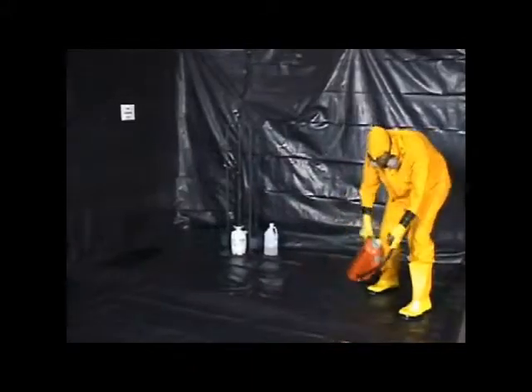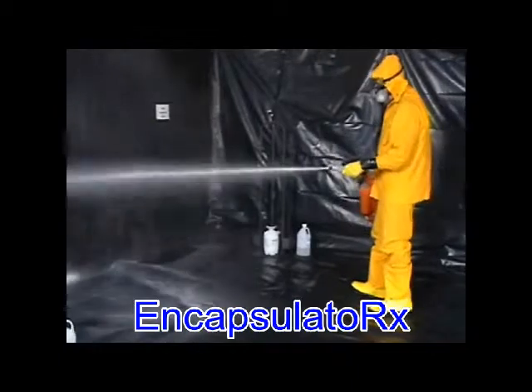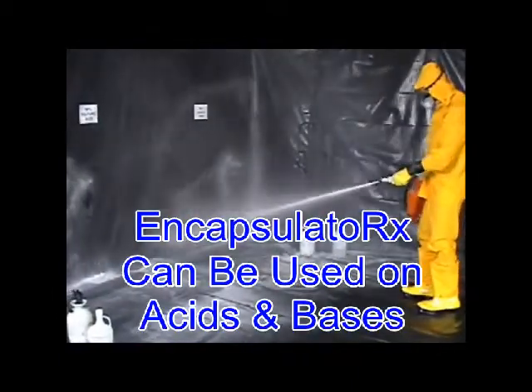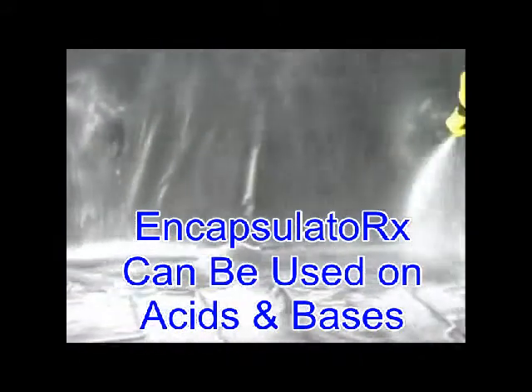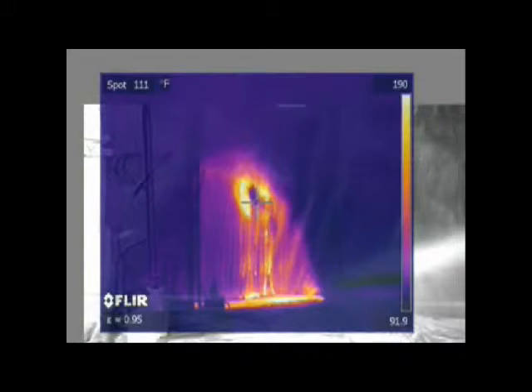The ability to spray the encapsulator product allows the spill or leak to be more safely worked from a distance. The encapsulator product is so unique and effective that it can be used on both the sulfuric acid and the caustic soda. These FLIR infrared camera pictures show the thermal changes during the process. Let me explain the thermal images.